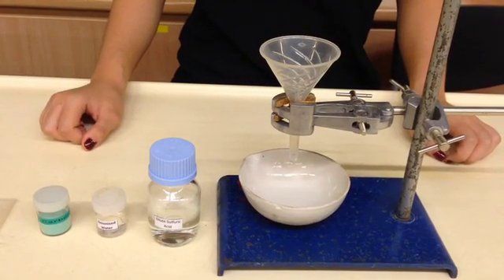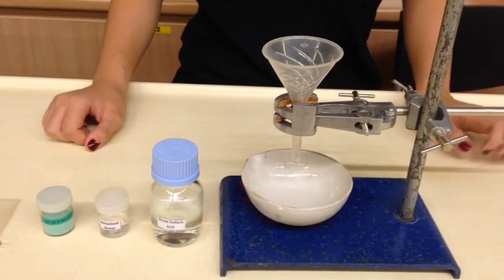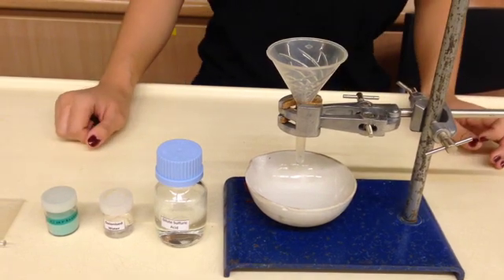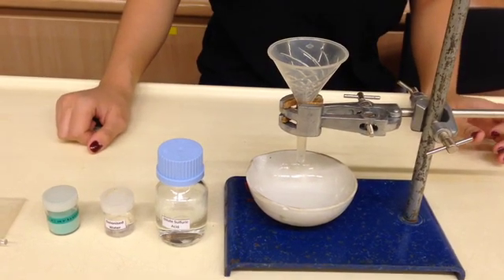Today we are going to be preparing a salt, copper 2 sulfate. So in this topic of salt preparation, there are three different preparation methods that you will need to know.